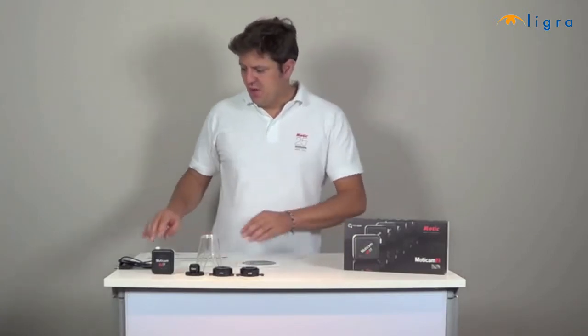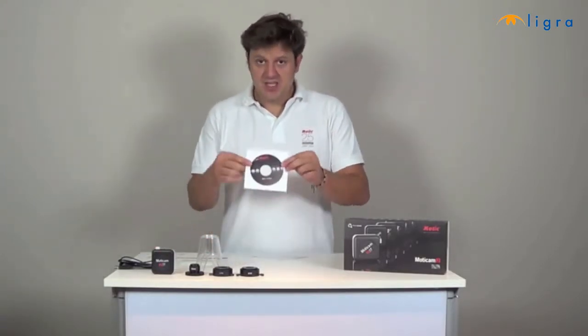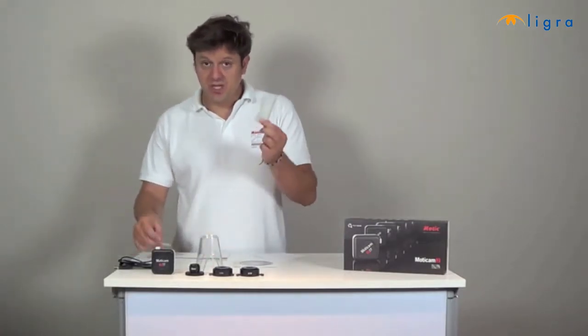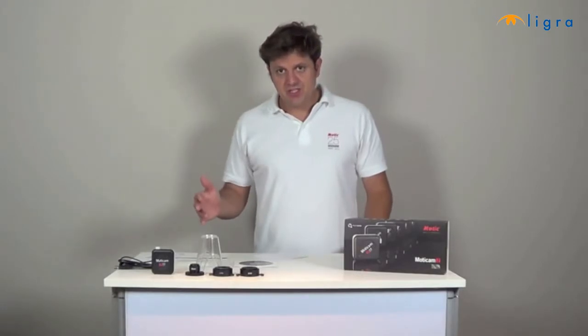All Moticam CMOS cameras come in one box with the tools you might need to mount your Moticam onto the microscope. What are these tools? Well, you will find a quick start guide that will help you to install and to use your camera. There is a CD with the software Motic Images Plus 2.0, compatible with Windows and with Mac. In order to calibrate the software, there are 2 calibration slides, one in glass, one in plastic. And we have on our website video tutorials that give you detailed information about our software and the calibration procedure.